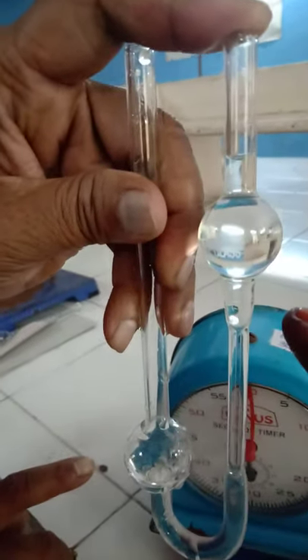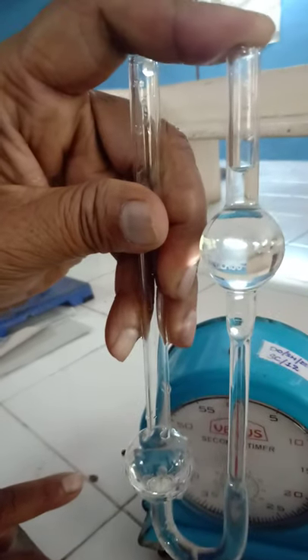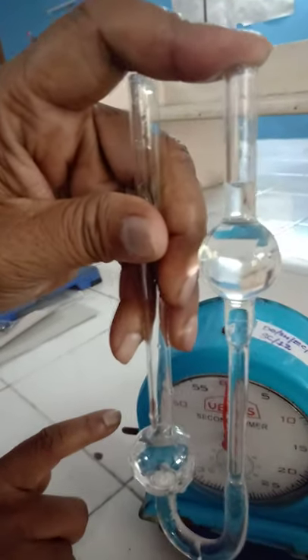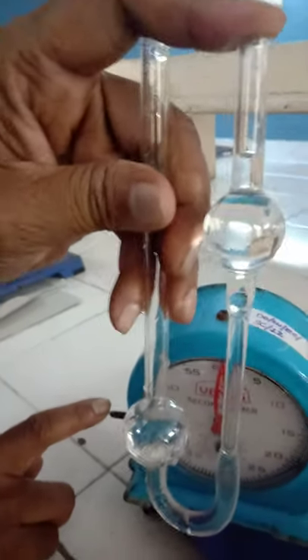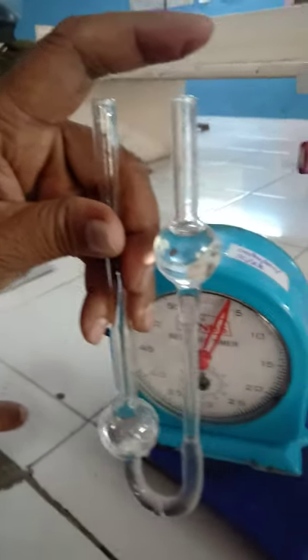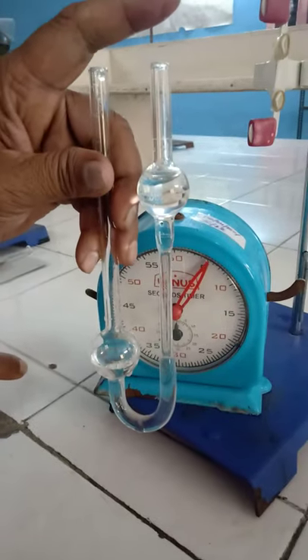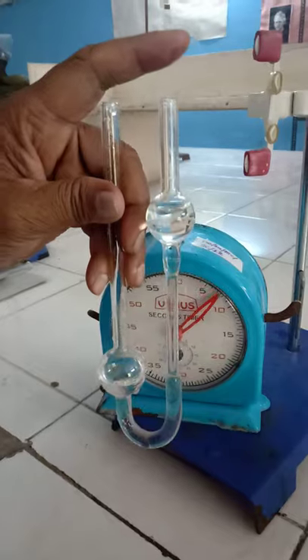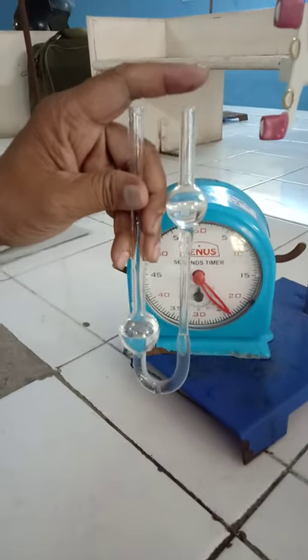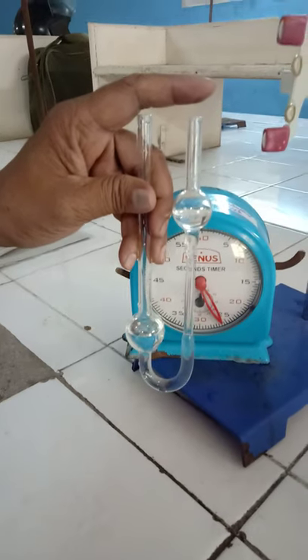Whenever the water reaches the upper mark, we should remove our finger and allow the water to flow from the upper mark to the lower mark. Whenever we remove our finger, we should start counting the time in seconds using a stopwatch. Time is measured using the stopwatch.